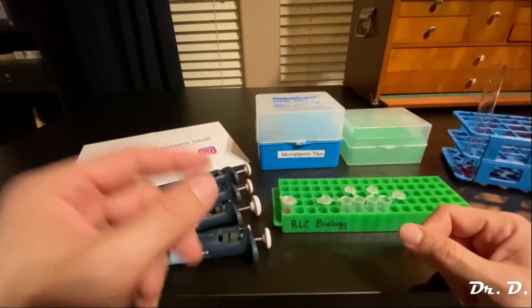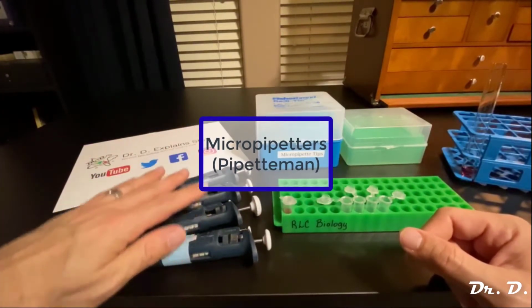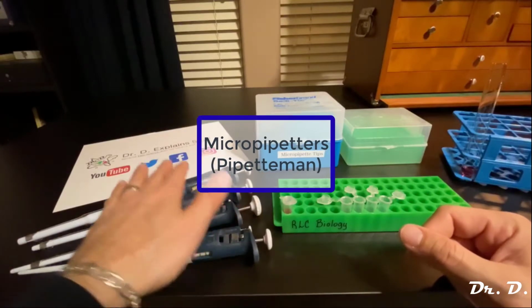Hey everyone, Dr. D here, and in this video I'm going to show you how to use these micropipetters. Sometimes they call these pipettemen.